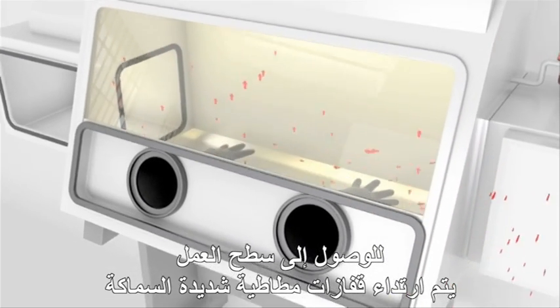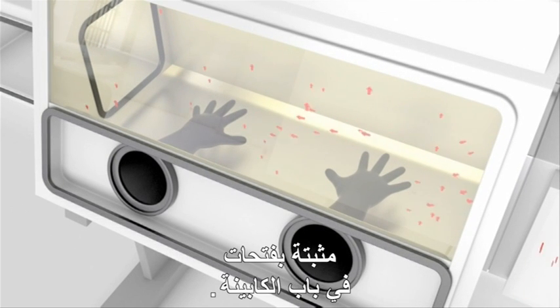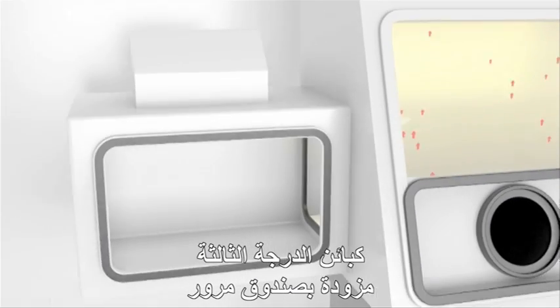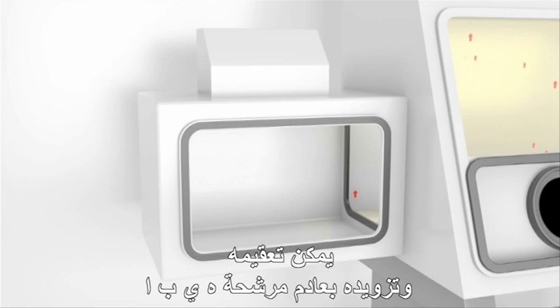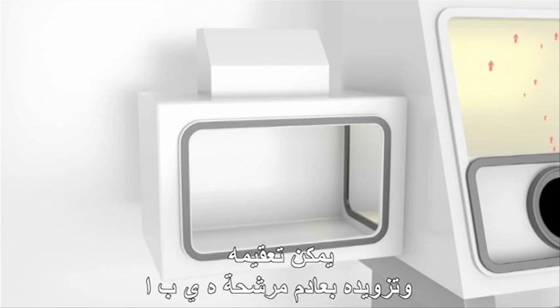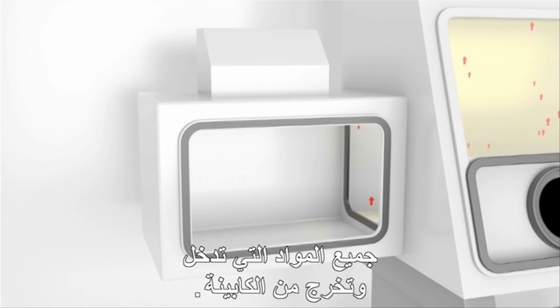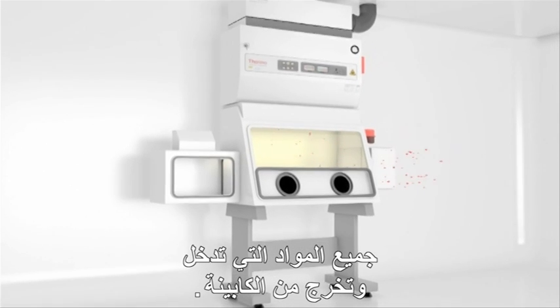Access to the work surface is by means of heavy-duty rubber gloves attached to ports in the cabinet door. The class 3 cabinet has a pass-through box attached that can be sterilised and equipped with a HEPA filtered exhaust, or a double door autoclave can be connected for the decontamination of all materials entering or exiting the cabinet.